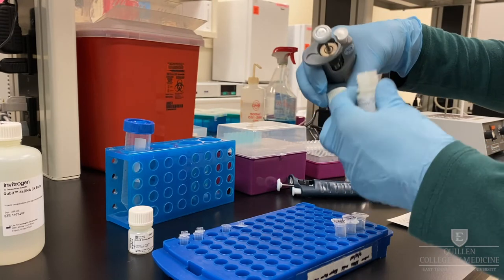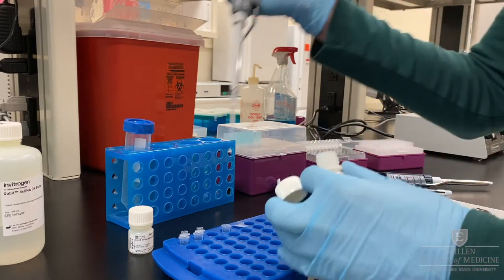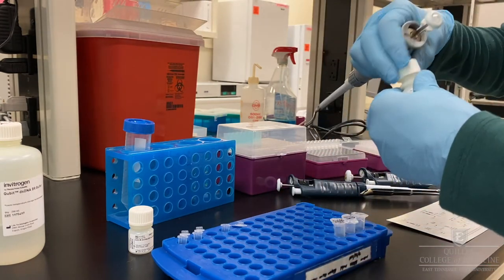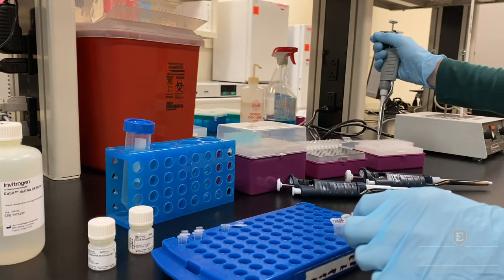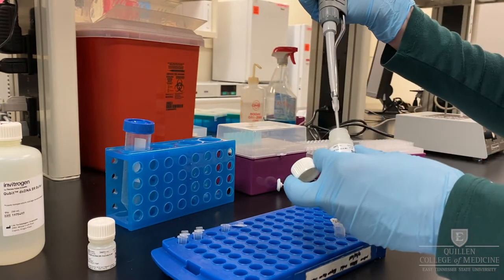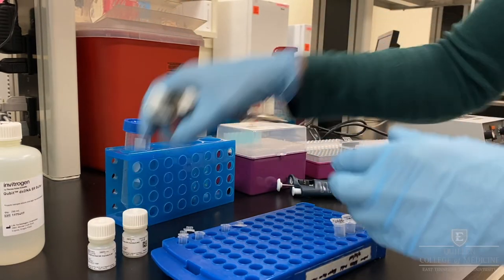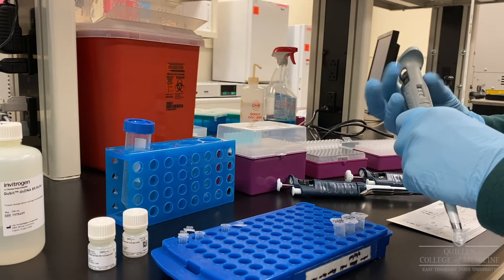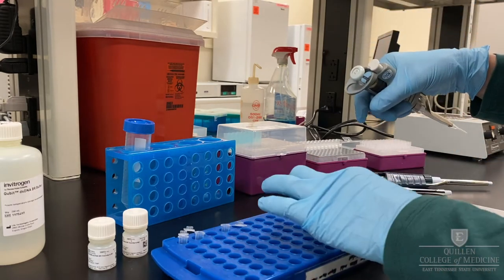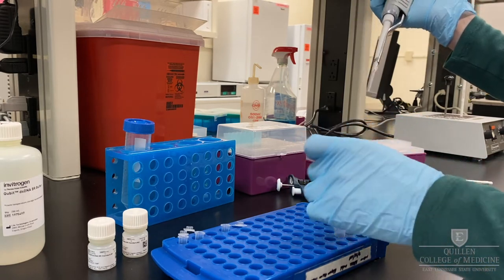For each standard, add 10 microliters — 10 microliters of standard 1 into the standard 1 tube, and 10 microliters of standard 2 into the standard 2 tube. Sample dilutions may use between 1 and 10 microliters, depending upon how concentrated you anticipate your sample being.